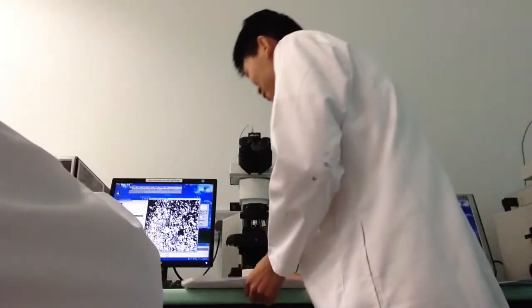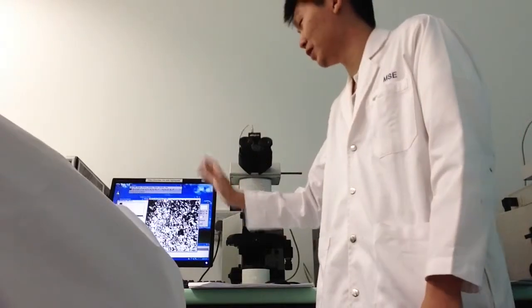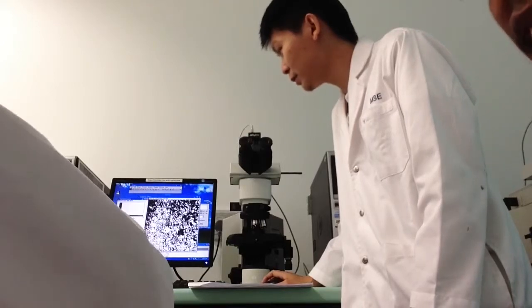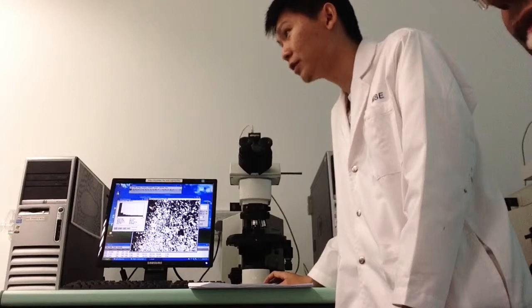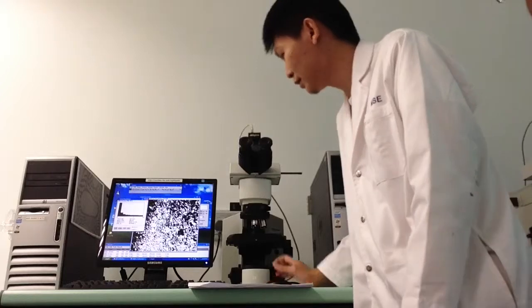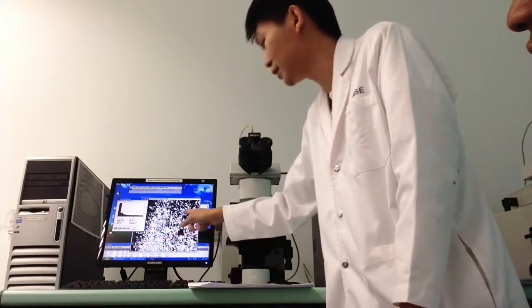So make sure that everything is visible before you print screen. Also remember that you should place your cursor below the last bar, because if you move your cursor somewhere else, this value is not your correct value. So you place it under the last bar, and then you print screen. Make sure that the yellow box shows everything.